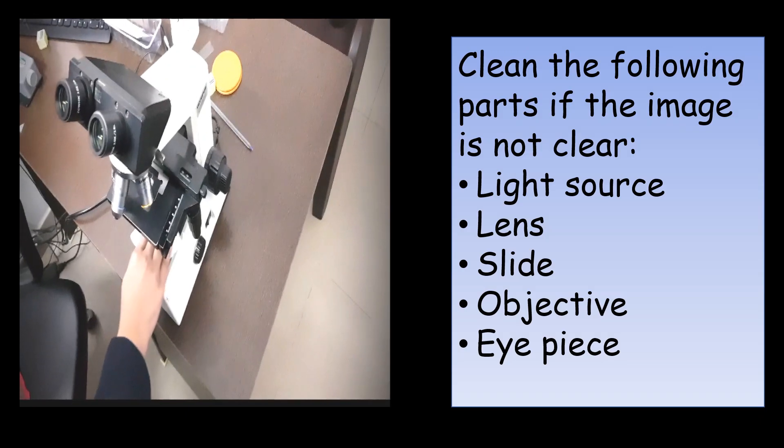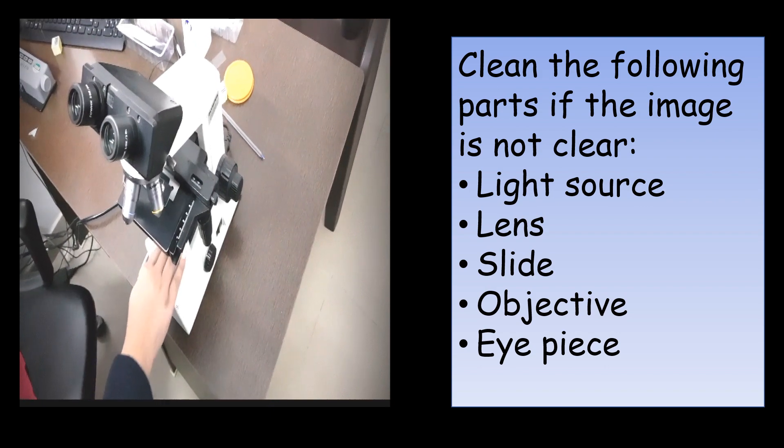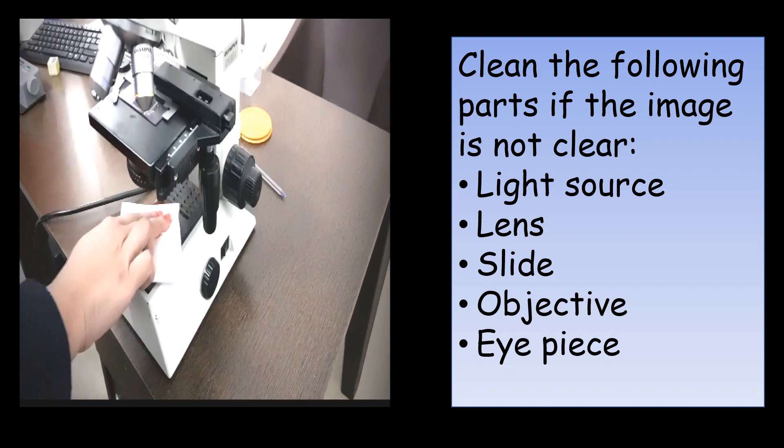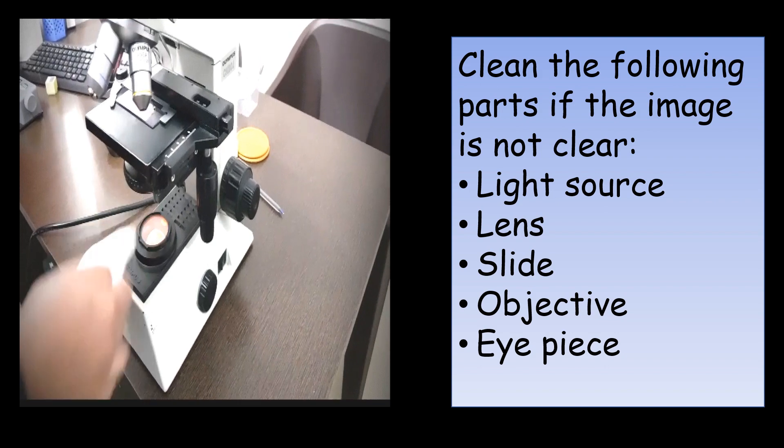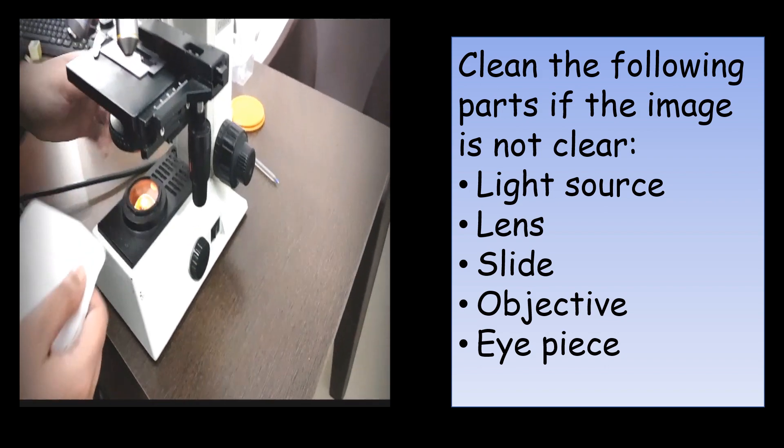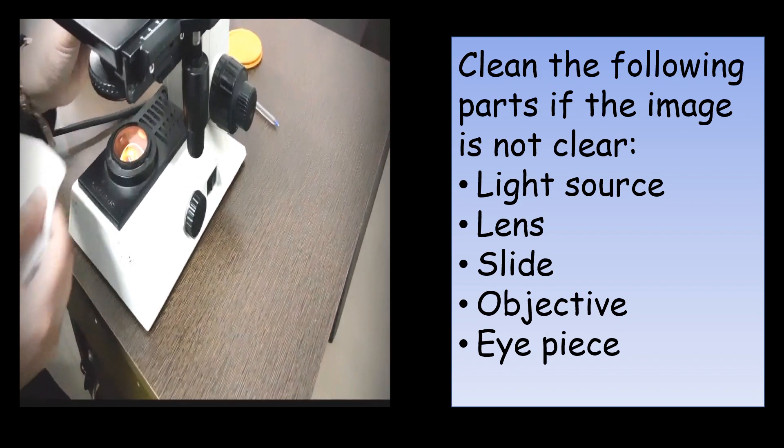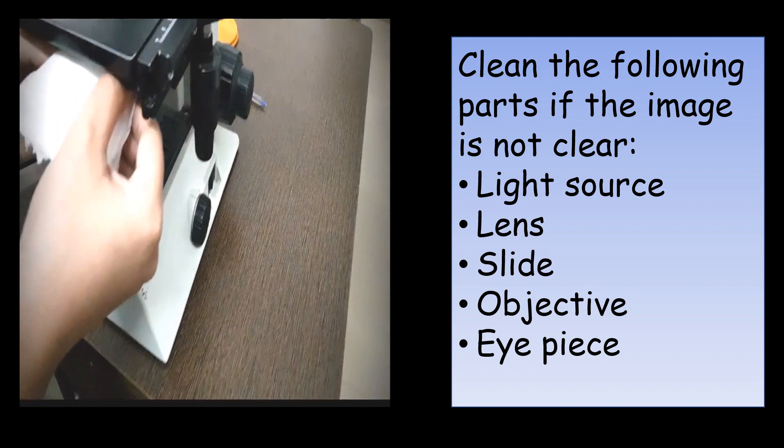The reason you may not have a clear image after following the instructions could be due to dust deposition. So clean the following parts: light source, lens, slide, objective, and eyepiece.